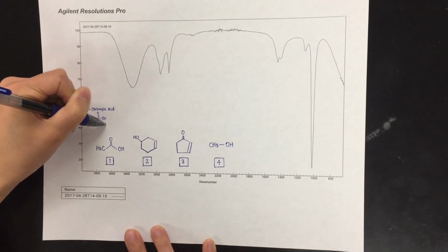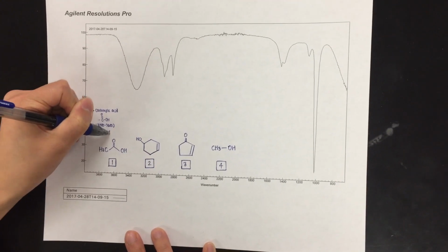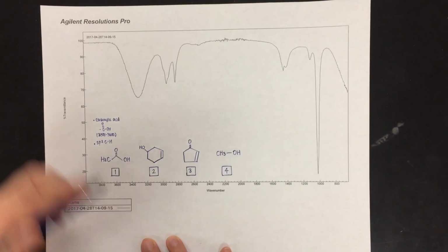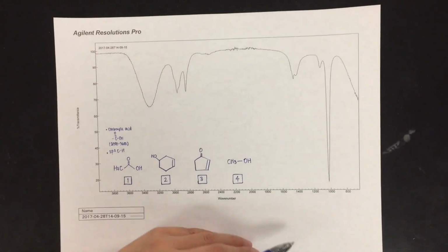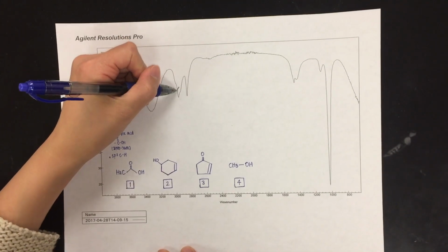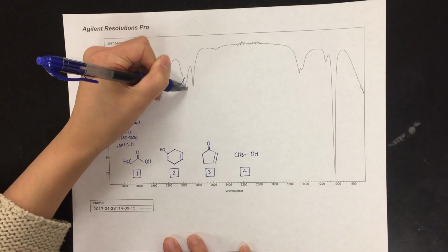The carboxylic acid makes a distinct peak between 2500 and 3600 wavenumbers. You can see an example of this peak in example 3 of your lab handout. The peak doesn't resemble the size and shape of a carboxylic acid peak. sp3 carbon bonded to hydrogen shows between 2,850 and 3,000 wavenumbers, which we can see here.